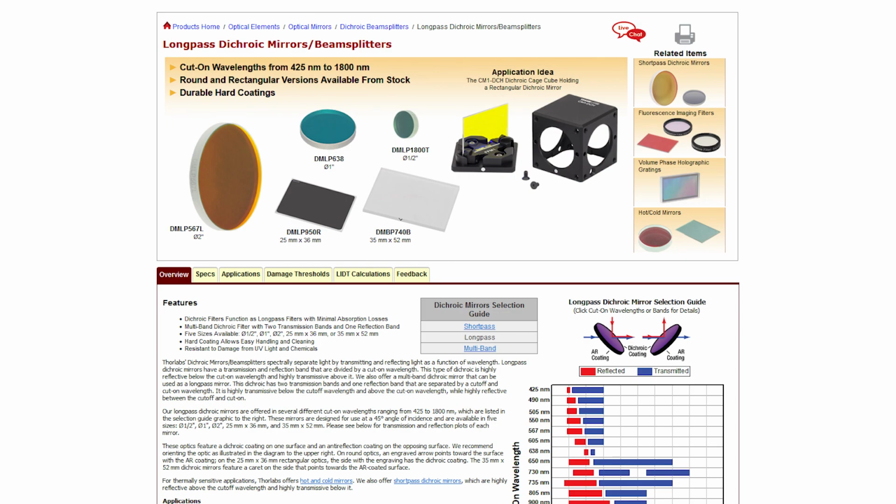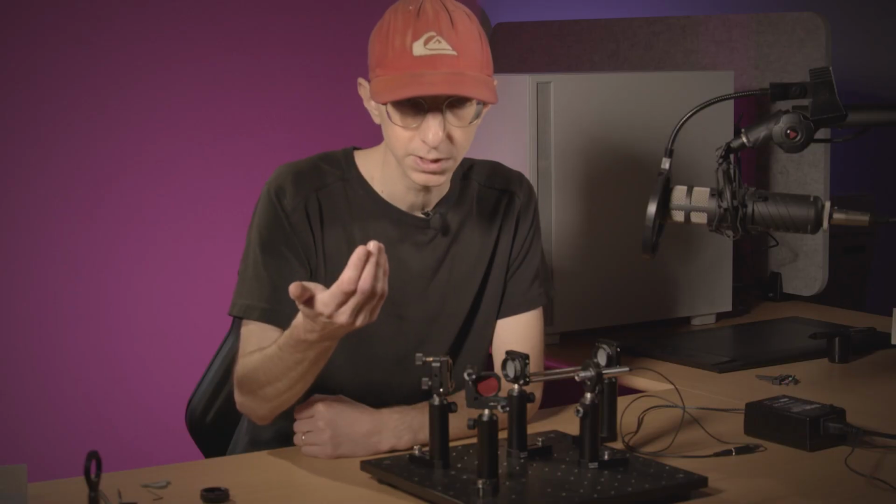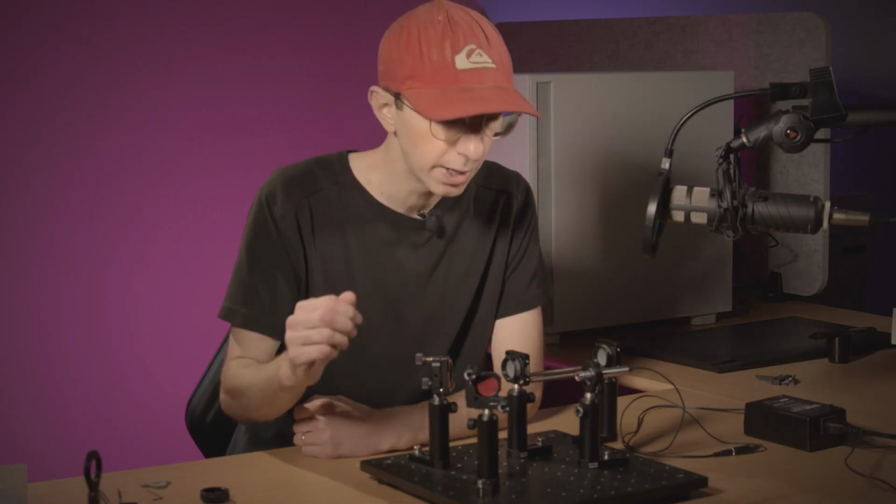Also, it's recommended to keep at roughly a 90 degree angle when you fold the beam, just for clarity purposes. But also, if you use a dichroic mirror, it has properties that are defined at a 45 degree incident angle, so you want to stick to roughly 90 degrees reflection when you are using a dichroic mirror. Also, it's recommended not to send the beam up in space, for safety purposes, to protect your eyes.